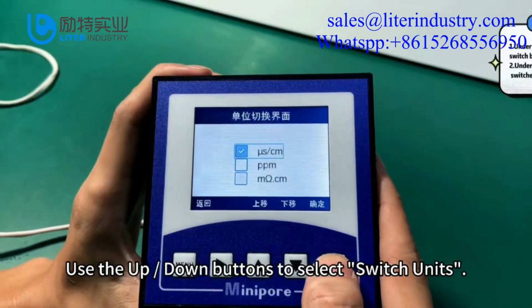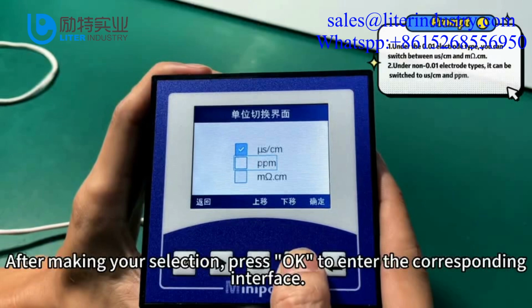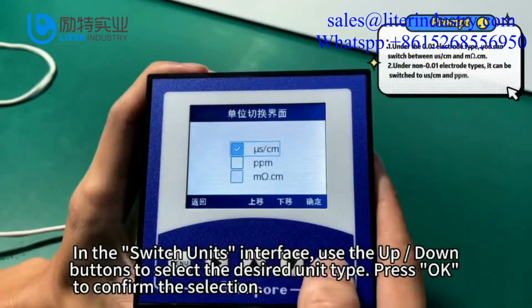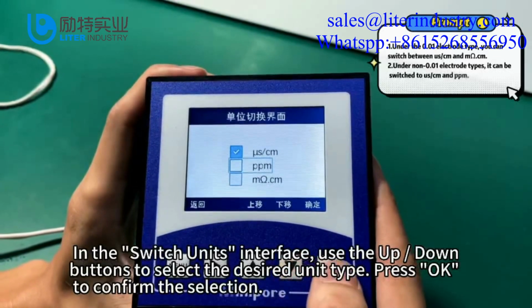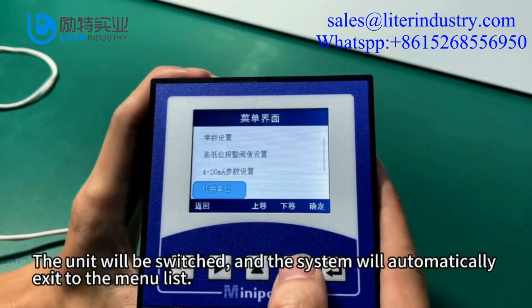Use the up-down buttons to select switch units. After making your selection, press OK to enter the corresponding interface. In the switch units interface, use the up/down buttons to select the desired unit type. Press OK to confirm the selection, the unit will be switched, and the system will automatically exit to the menu list.